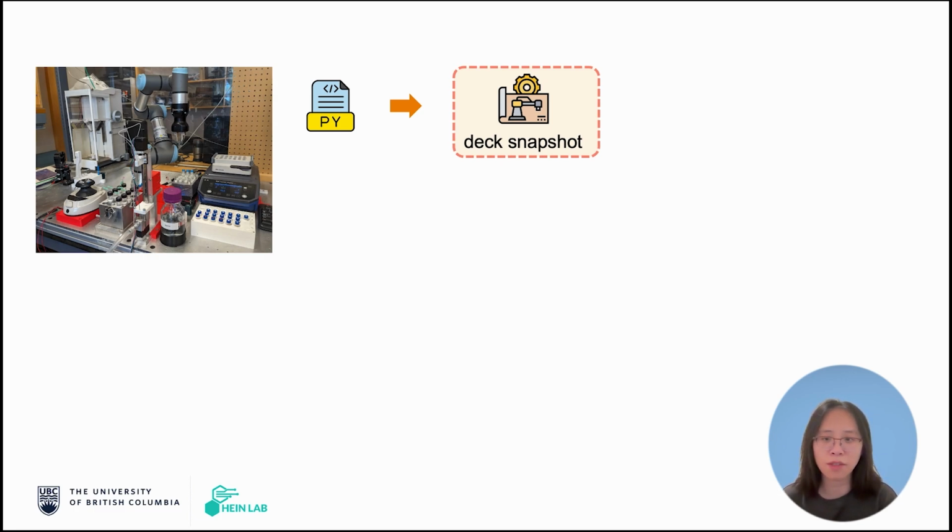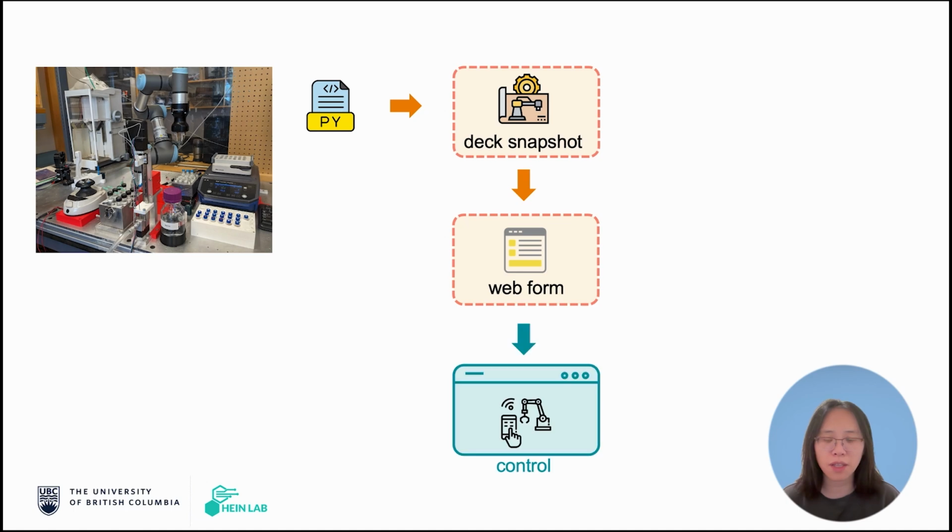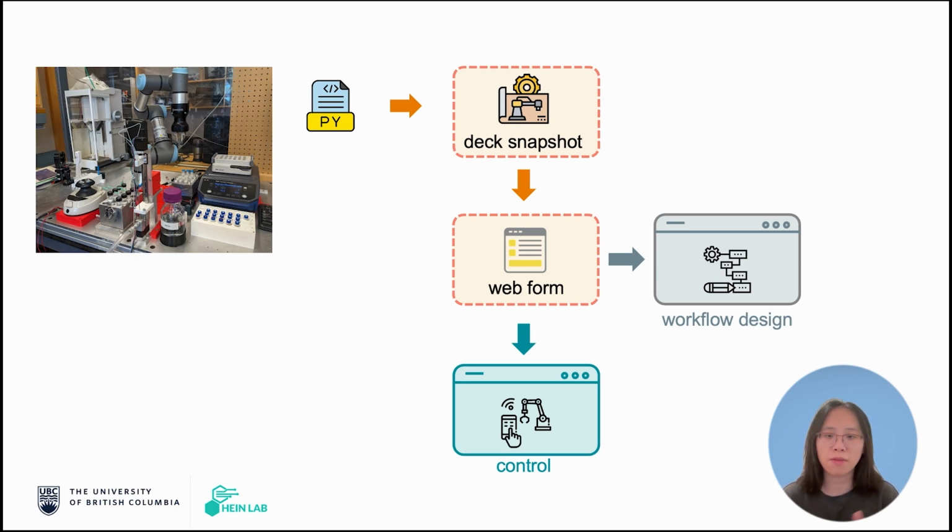We then use this information to generate an interactive platform for each function. Over the control interface, we display all the functions for each instance as cards, and users can just fill in the parameters and call those functions to interact with the robot. Alternatively, instead of calling these functions right away, we can also add the function into a workflow design. By stacking multiple actions, we can build our own experimental workflow.